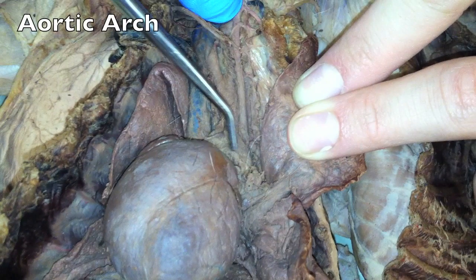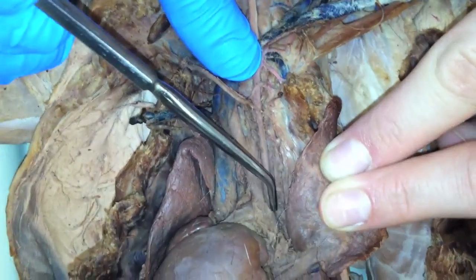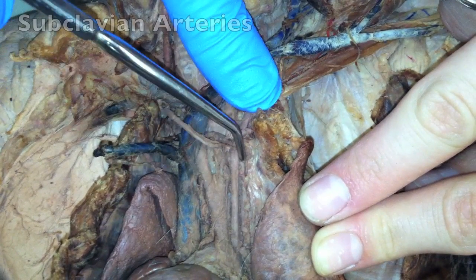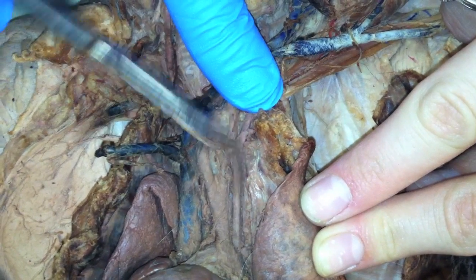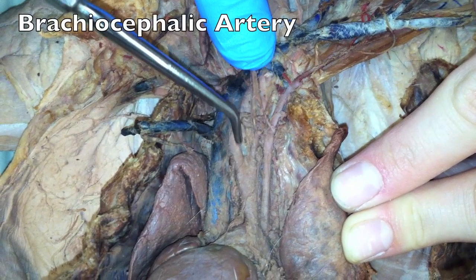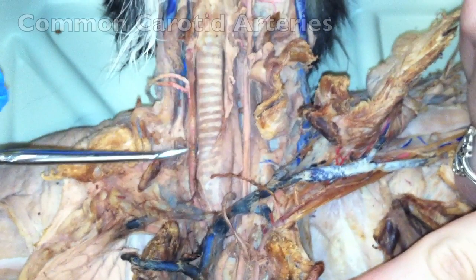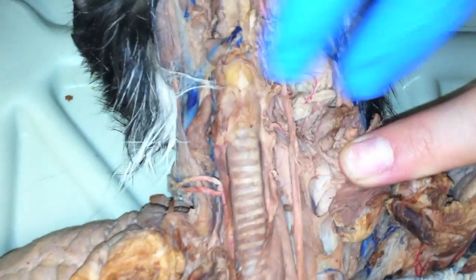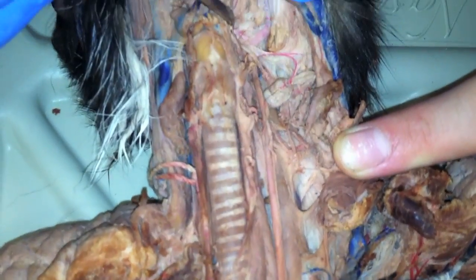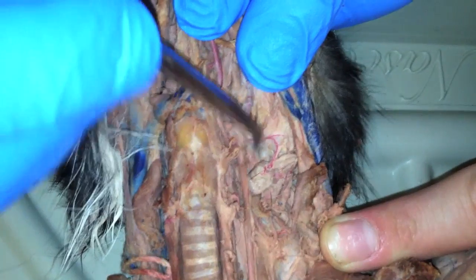Aortic arch. Left subclavian. Brachiocephalic. Common carotids. So the common carotids come up to here, and there's a three-way branch, and they branch into internal.